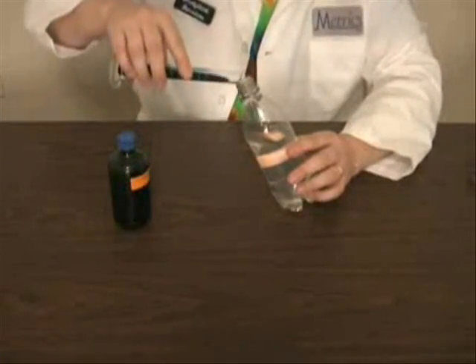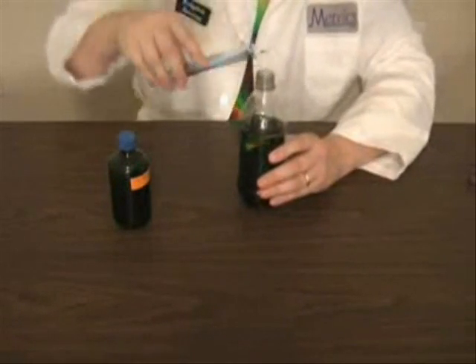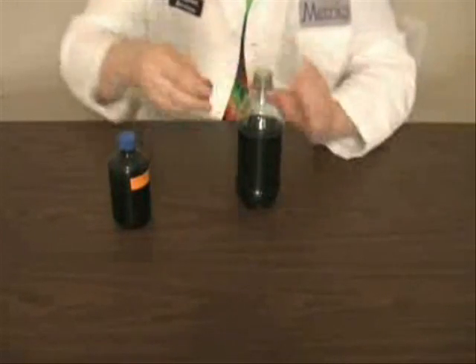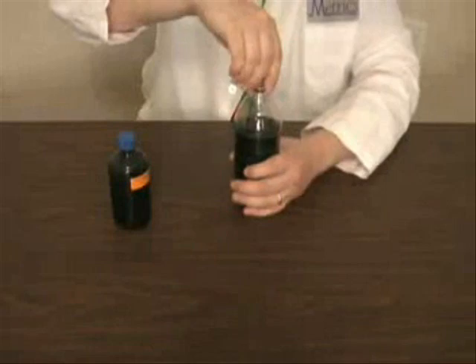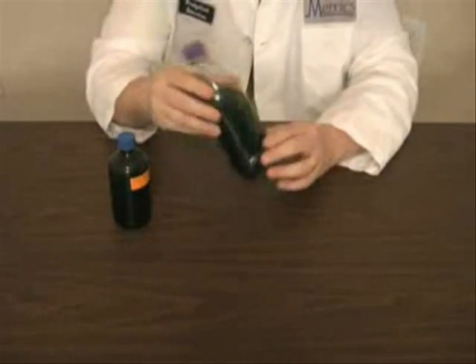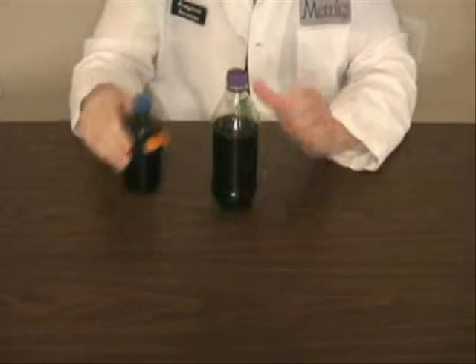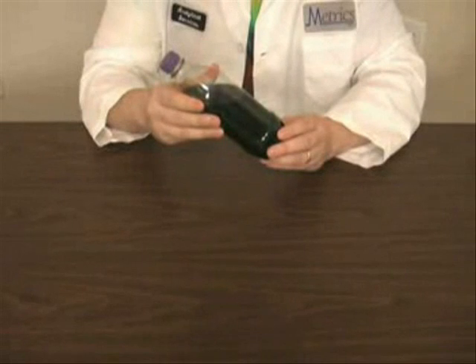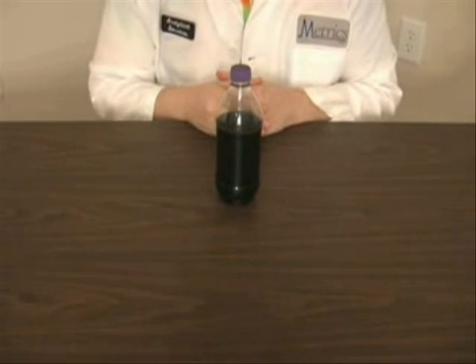And last but not least, we add a small amount of an indigo dye. And now we're going to allow the solution to sit for a moment.